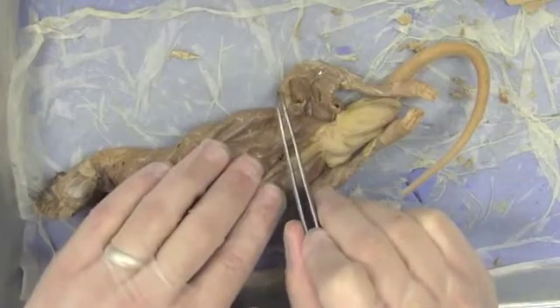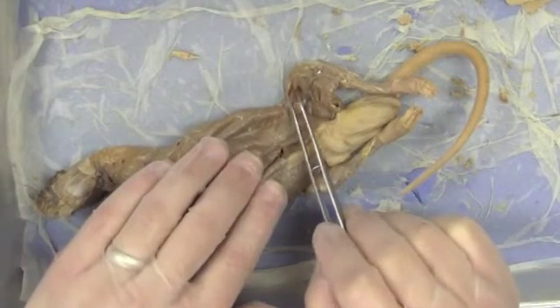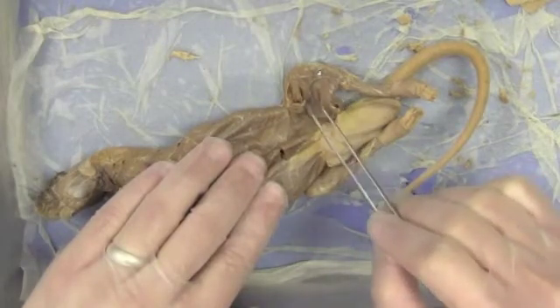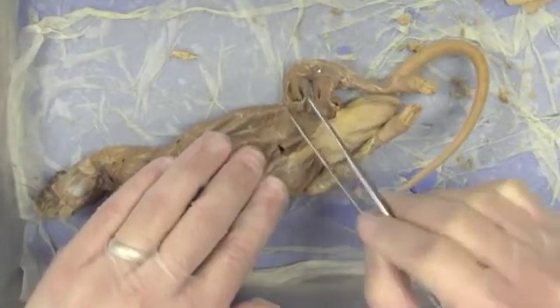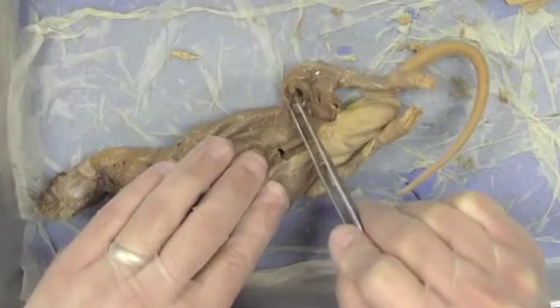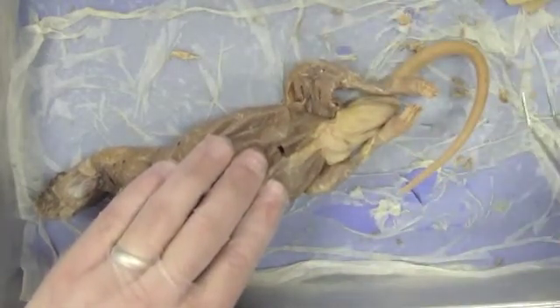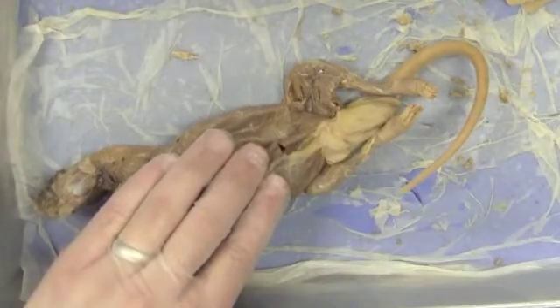We've got, again, the tensor fasciae latae — we saw this one on the lateral surface as well. Immediately behind that is the rectus femoris, and we can orient ourselves by this large vein and artery passing through the thigh. On the outside of that large vein and artery, the most noticeable muscle is the vastus medialis. So we have the tensor fasciae latae, rectus femoris, and vastus medialis — together with the vastus lateralis from the other side, those are three of the four quadriceps muscles. The one we're missing is the vastus intermedius.